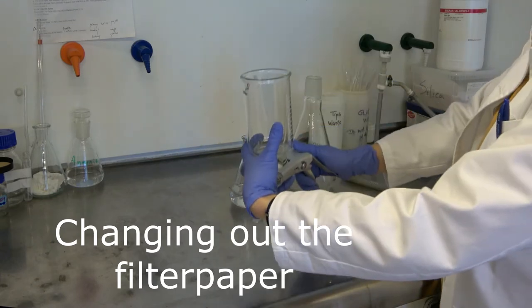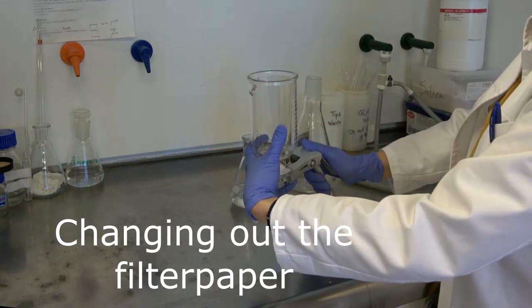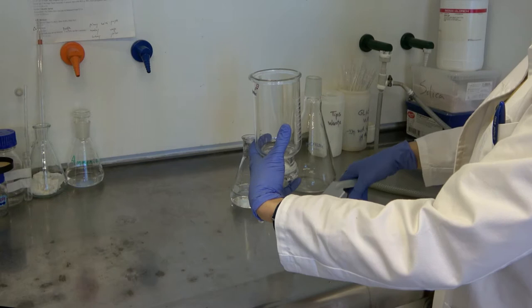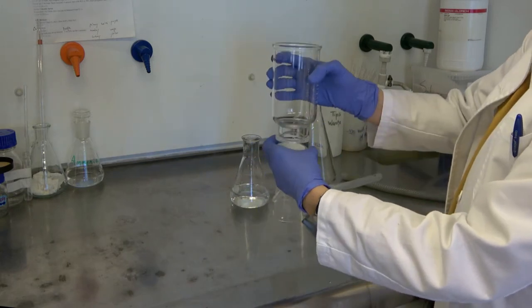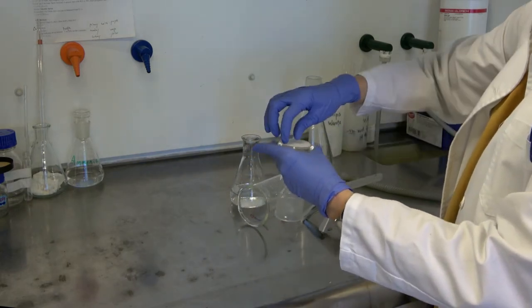Periodically the Millipore filter must be changed out. The clamp that holds the two glass components of the filter glass is first removed. Sandwiched between them is the filter paper.